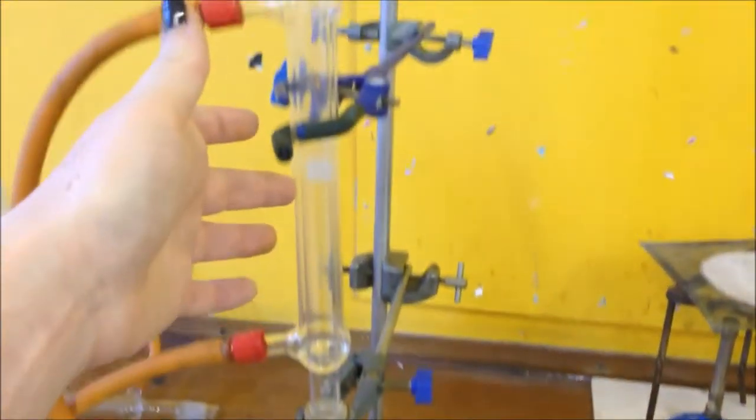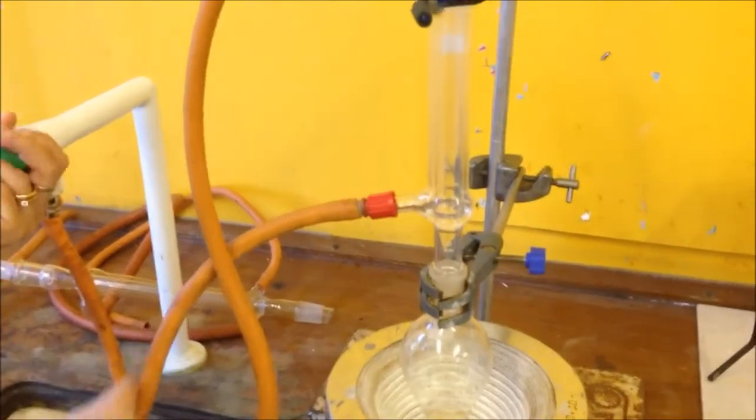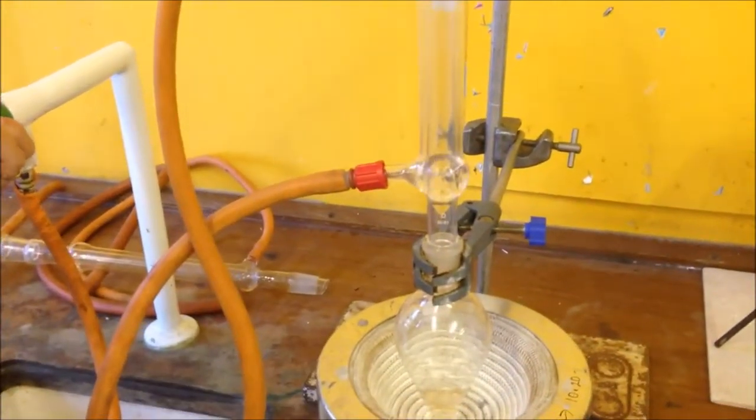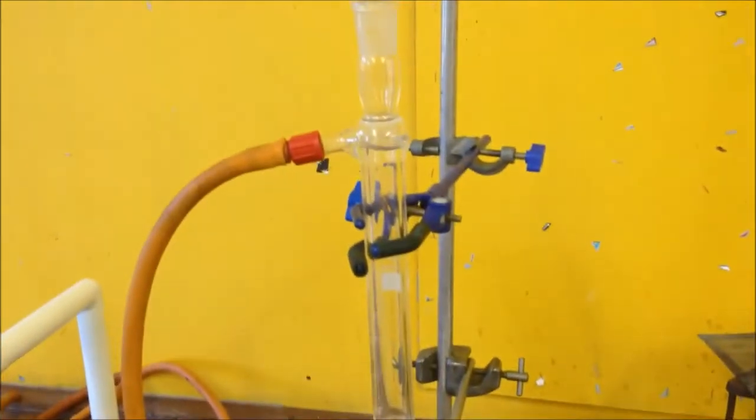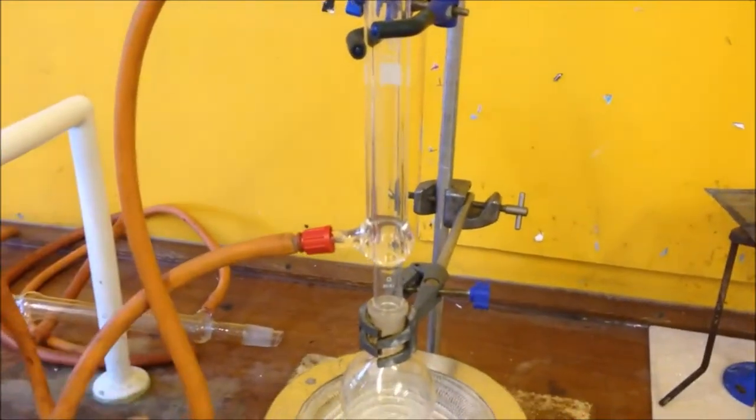We've got it connected to our reflux condenser and water goes in at the bottom. We can see that filling up and then water will come out through the top.